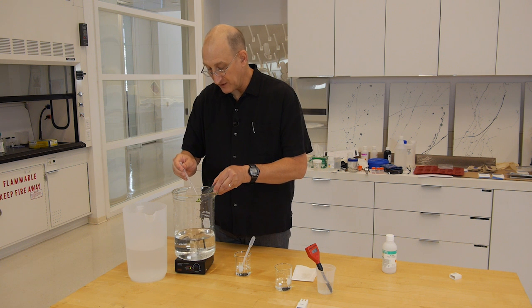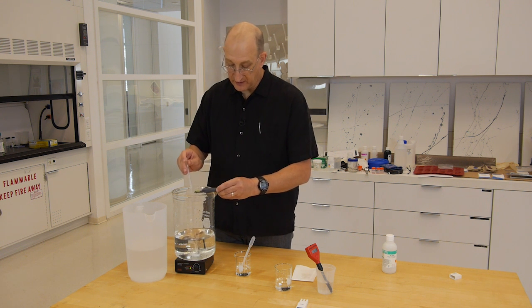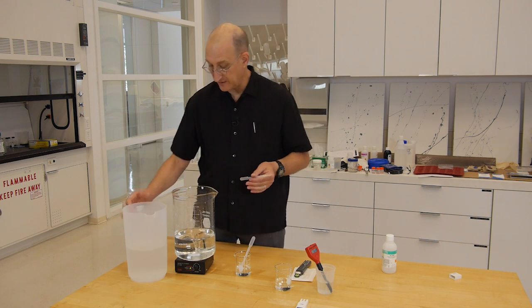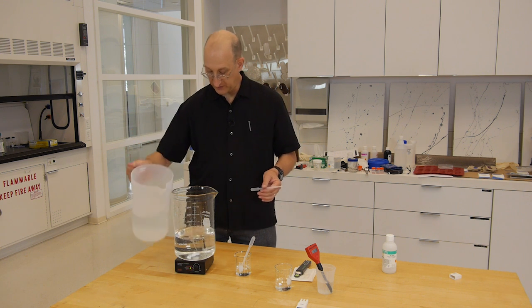And we can kind of rinse the meter and take a new reading at the same time, just by kind of squeezing some solution in there, and get another reading. So now we're at 8.4. We'll continue diluting down until we get to 6.0 microsiemens.